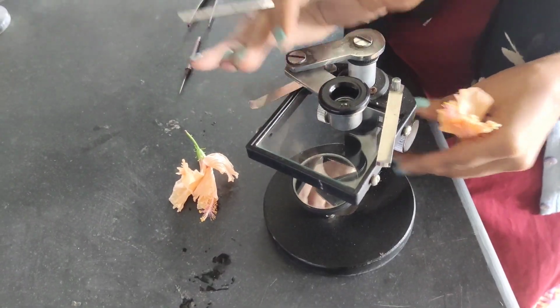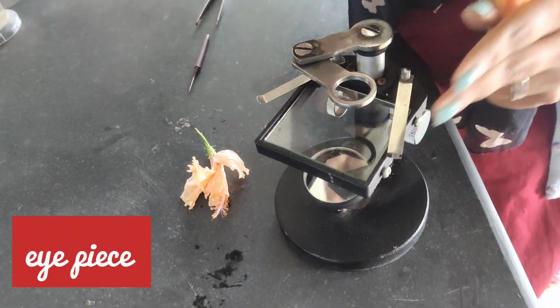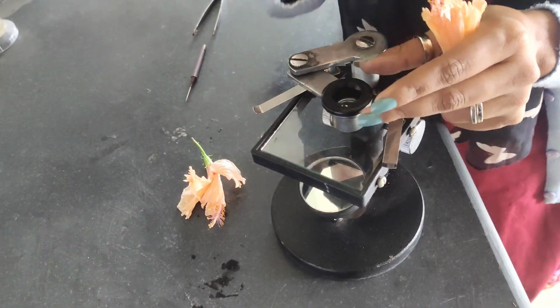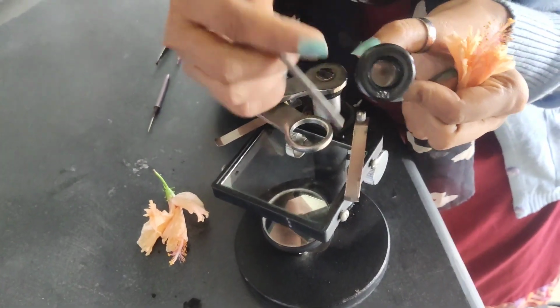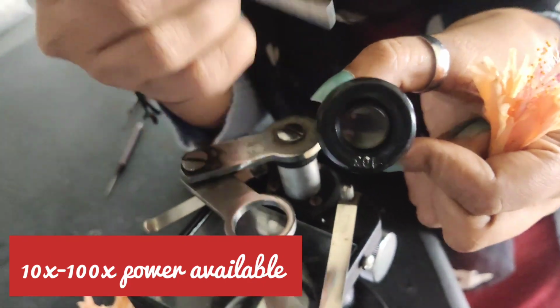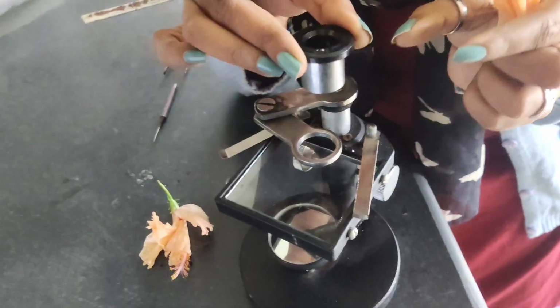I'll first of all tell you that what are the parts of this microscope. This is the eyepiece and in the eyepiece we are having this lens. Let me first of all tell you that the magnification of the lens is quite lower. Here I am having just 10x. It goes from 10x to 20 till 100x as well, but here this is a very low magnification power that I am having over here.